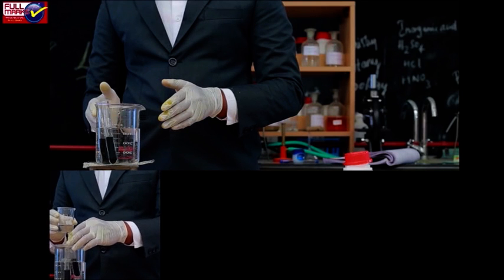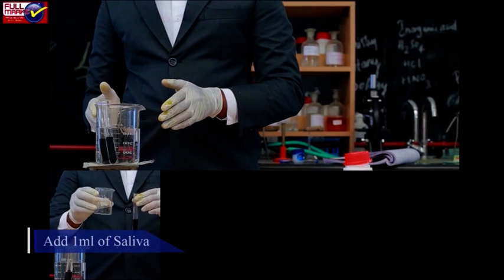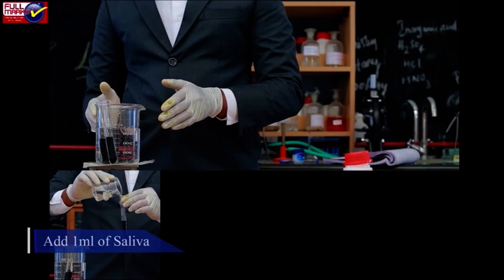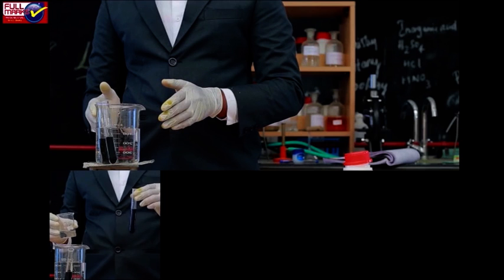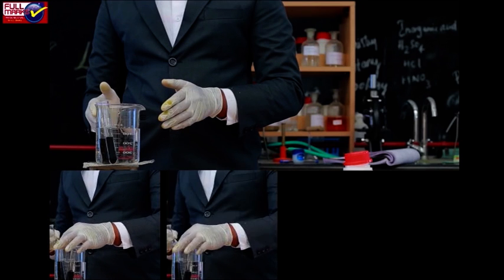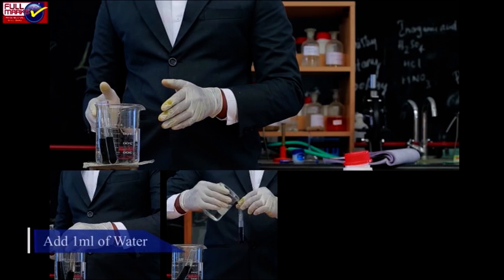Add 1 ml of dilute saliva to the experimental test tube and 1 ml of water to the control tube.